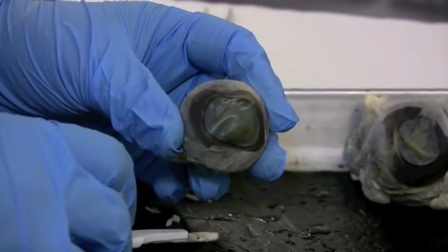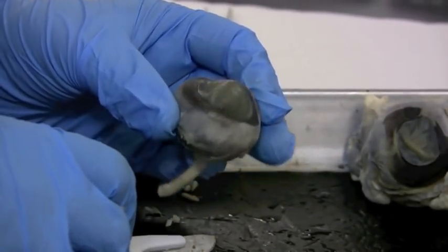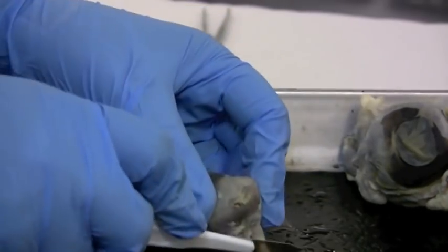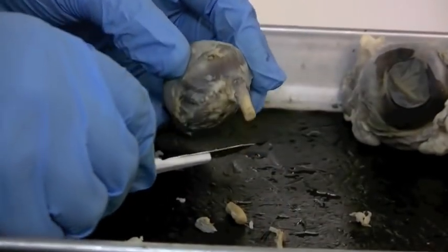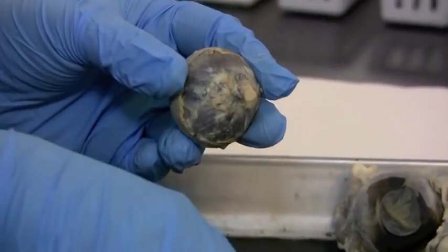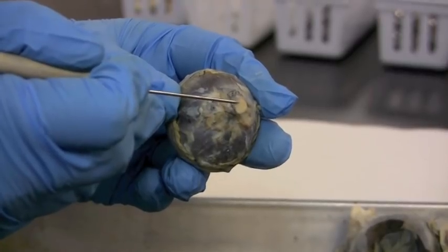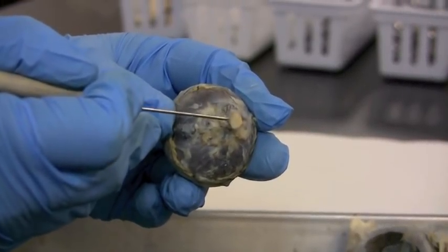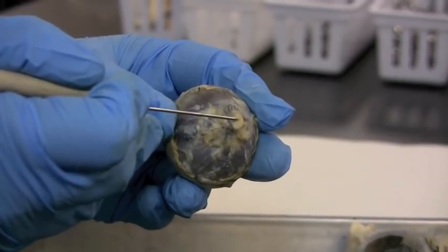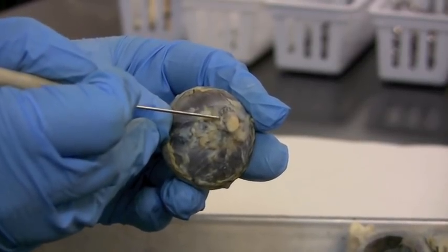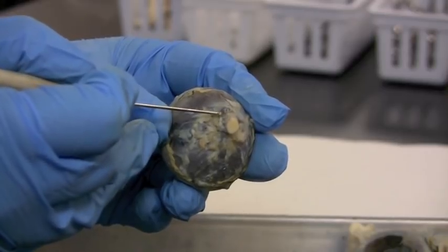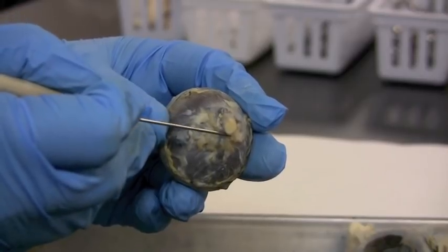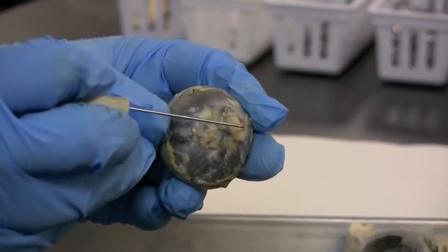To make our first cut, first we can see what's going on in this optic nerve. If we just slice right through it, a transverse cut here. And if we look at this cut, you should be able to see if you look really closely, there's a ton of fibers coming out of here. They gather at the retina, the retina comes through, kind of turns inside out to become this optic nerve, which is a big bundle of fibers. So it's just like a cable.